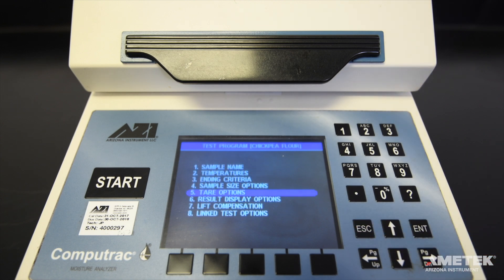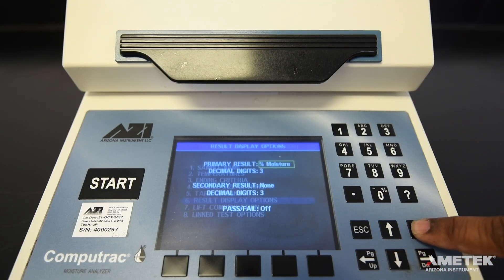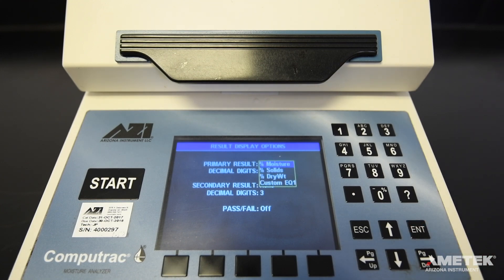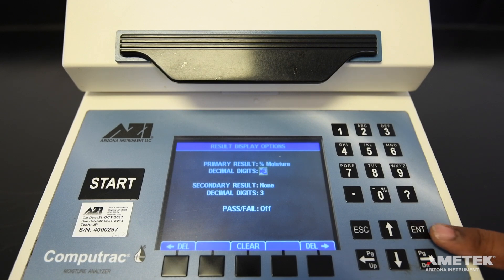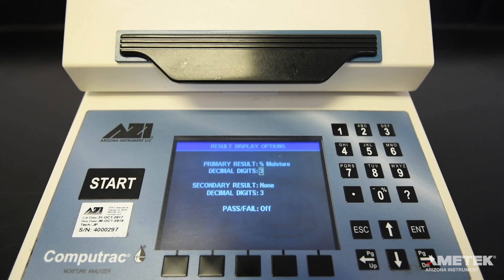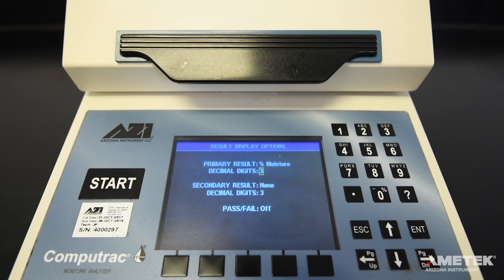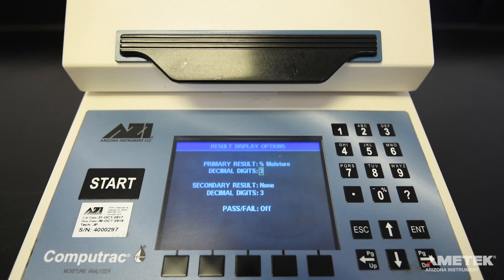The next parameter to edit is the result display options. For most tests, the primary result will be set to percent moisture. Other options are percent solids and percent dry weight. Set decimal digits to the number of decimal places you want the instrument to display after the decimal point. The Max 4000 XL can be set from 1 to 5, while the Max 4000 is fixed at 2 decimal places. The Max 4000 XL can also use a custom equation for the primary result and has an option to add a secondary result. For more information, contact Ametek Arizona Instrument or your local representative.